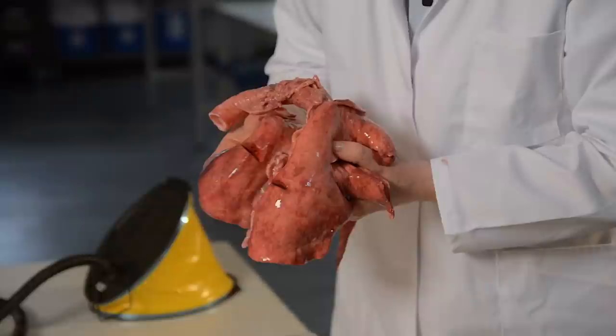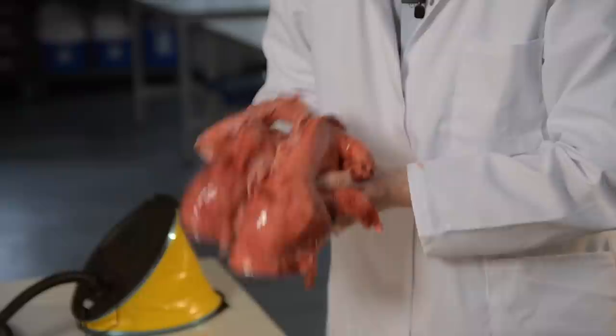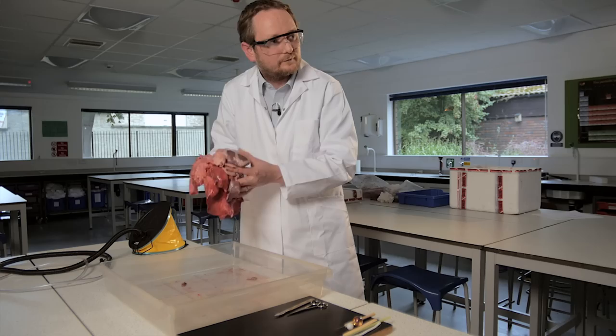The lungs, slightly small maybe, but if I was to open up a person, they would look pretty much exactly the same. And there in the middle of the chest is the heart.